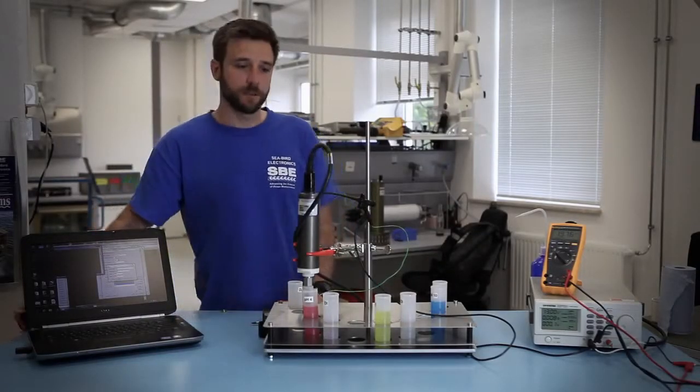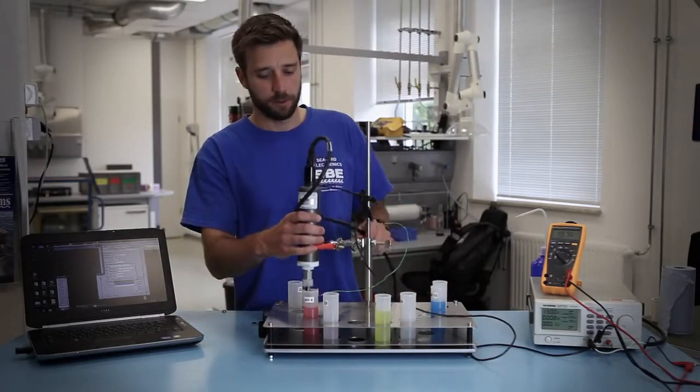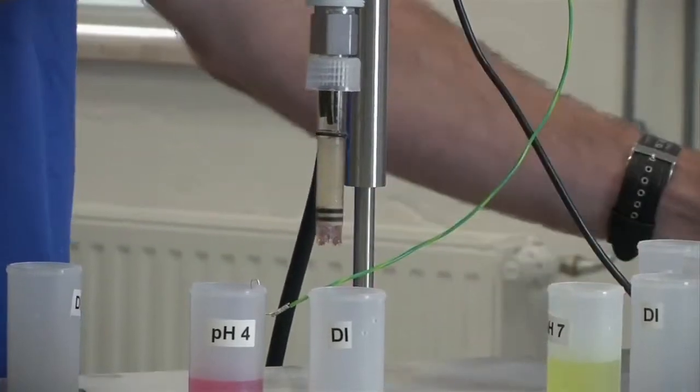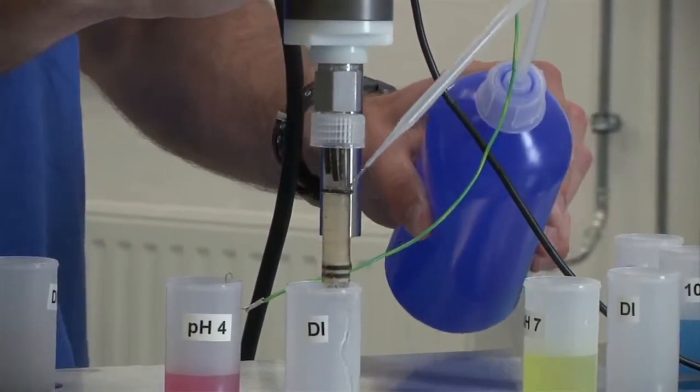And so then it asks you for your next pH buffer solution. So we'll move it into our next solution. You want to make sure that you rinse off the electrode prior to placing it in the next solution.